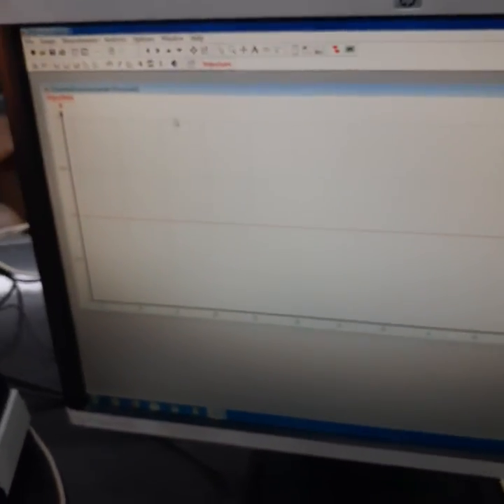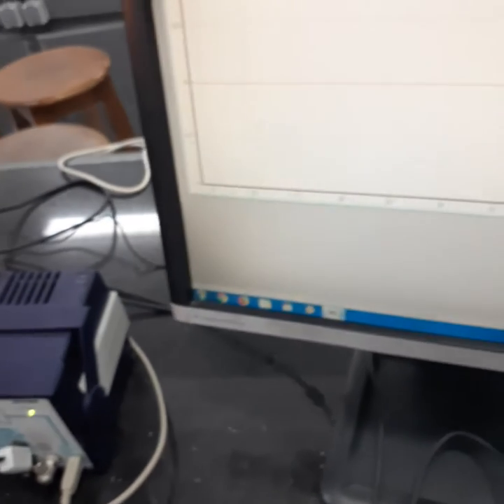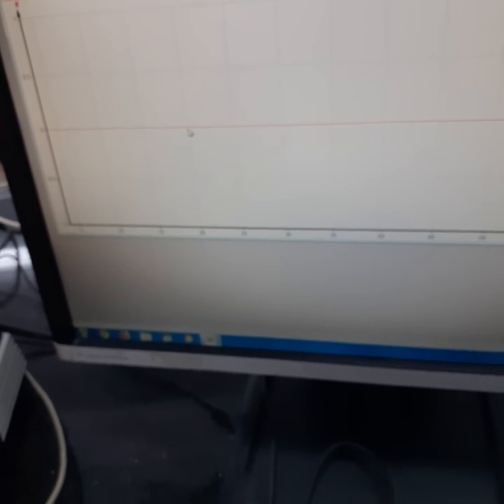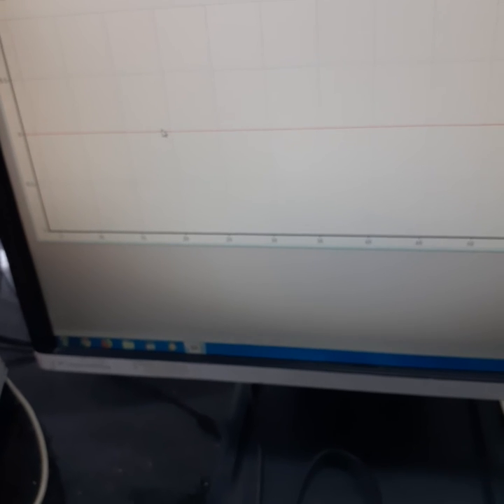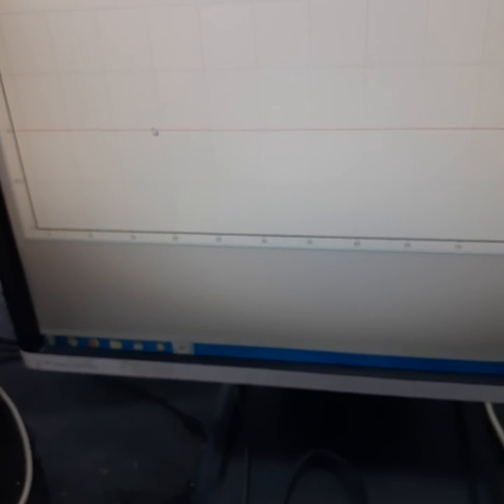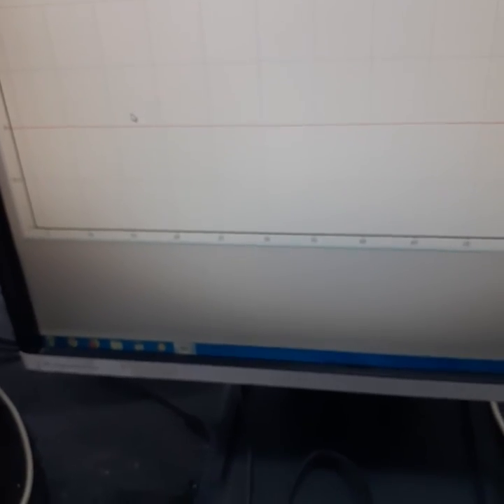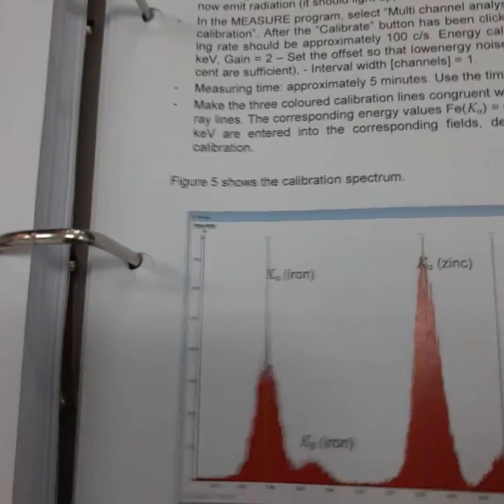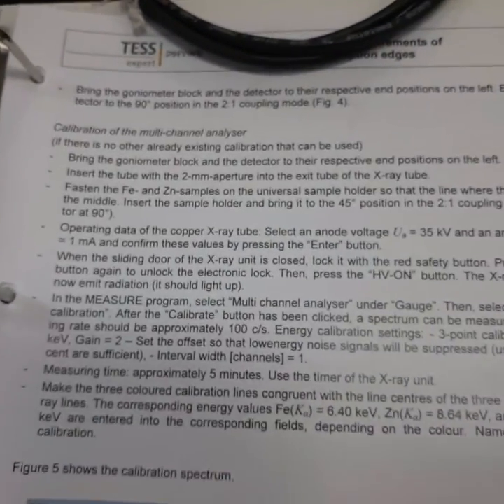Yes, there is a connection between the software and the multi-channel analyzer, but there is no data appearing on the software here. So please, if there are any mistakes I have made in this video, please reply to me as soon as possible, so I can fix our problems here to see the same figure that exists in the manual here. Now I think there is a misconception between my understanding of this manual and the comments you have sent us in the last email.